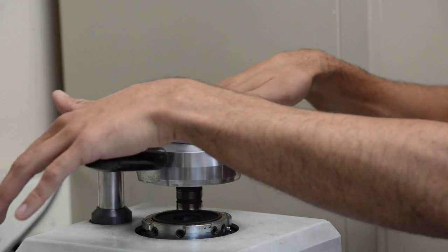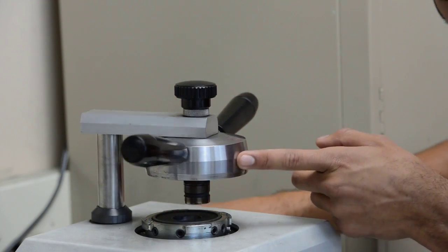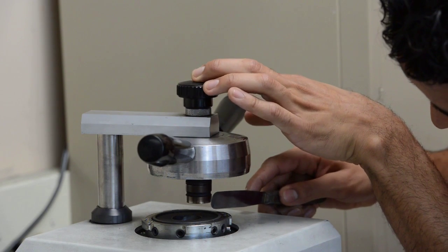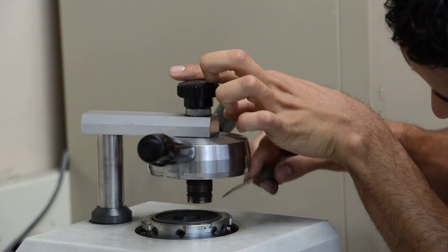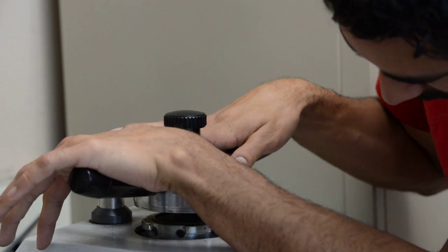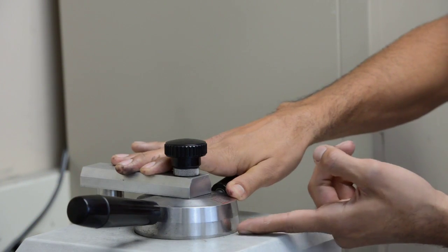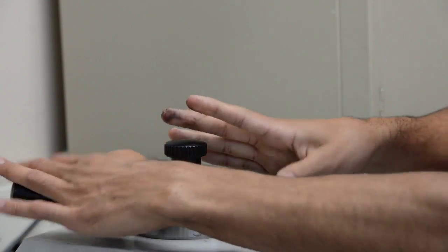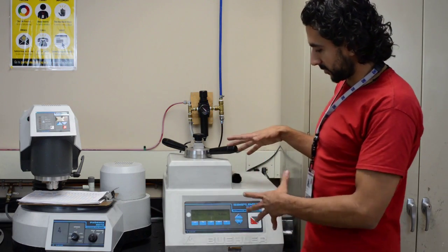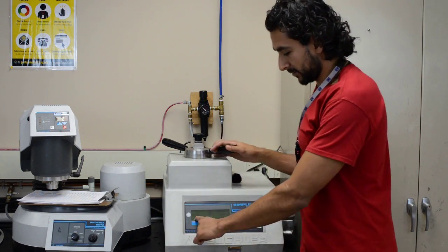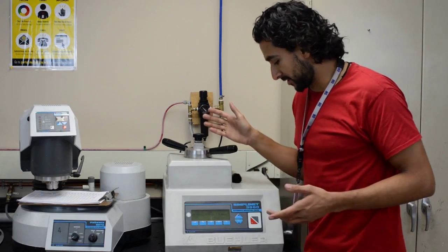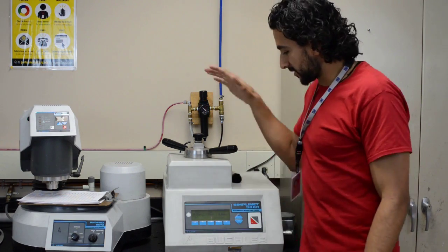I have to lower it enough so this will go in properly. Usually from the previous run, there's traces of conductament on this piece of metal here. So make sure you take them off because those pieces of conductament won't let you push this in all the way. So I push this in all the way until it hits the bottom here, and then I twist it. And it's ready. All you have to do now is press the cycle start button. And the machine will start pressurizing, and then it will heat for 10 minutes, then it will cool down for 4 minutes, and it will beep and your sample will be ready. In this case, my dummy puck. So let's just wait 10 minutes.